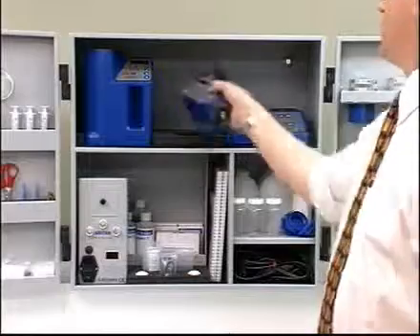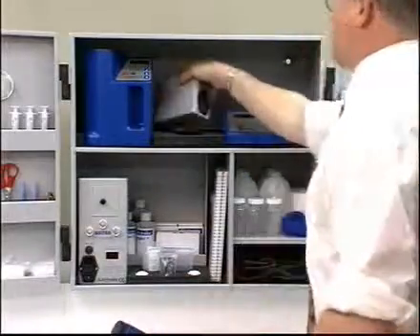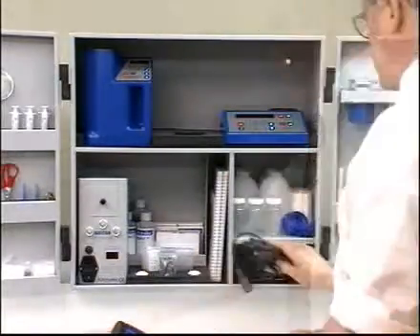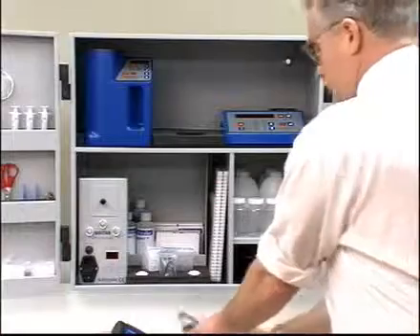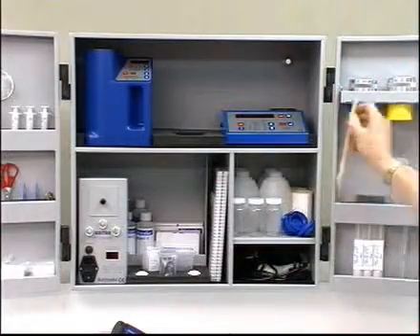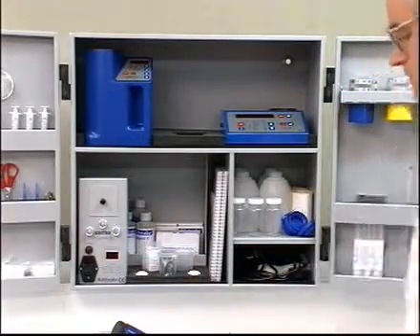This section shows you how to calculate viscosity at a range of temperatures and density correction from 50 degrees Celsius to 15 degrees Celsius in vacuo.